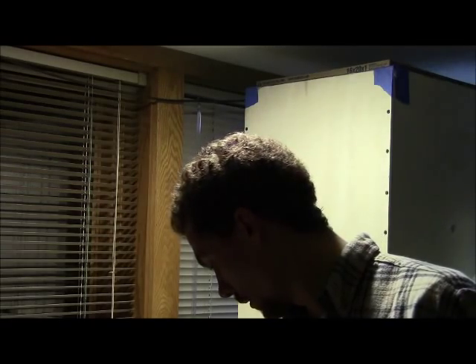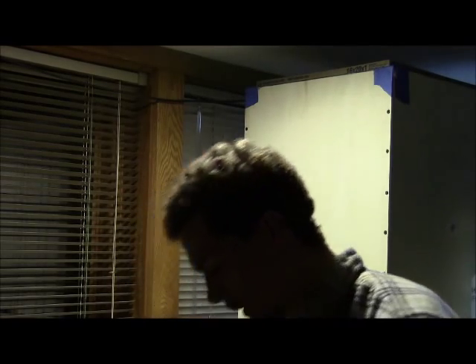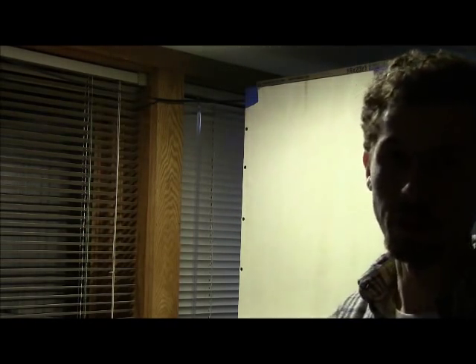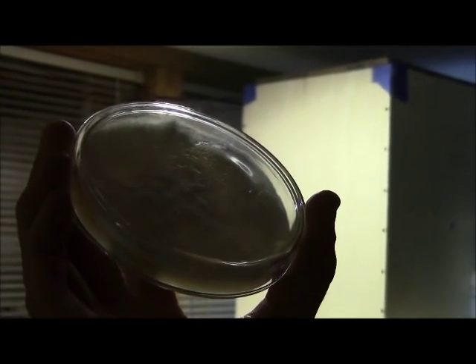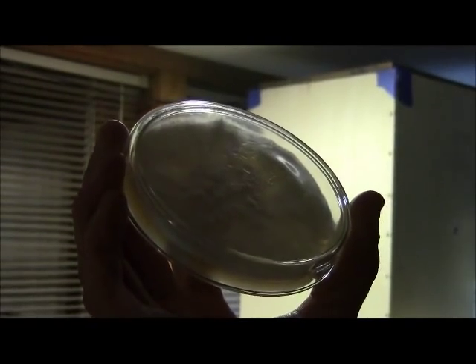I'm going to show you some of the petri dishes I've been working with. I started these a few weeks ago — actually showed you the blank petries about two weeks ago when they'd just barely gotten started. Now at about 14 days out, it's the 23rd today and I had done these on the 9th, so you can see there's some pretty good growth in there. Looking pretty happy and healthy. Now I'm going to make basically a slurry out of this and inoculate directly into some sterilized jars.